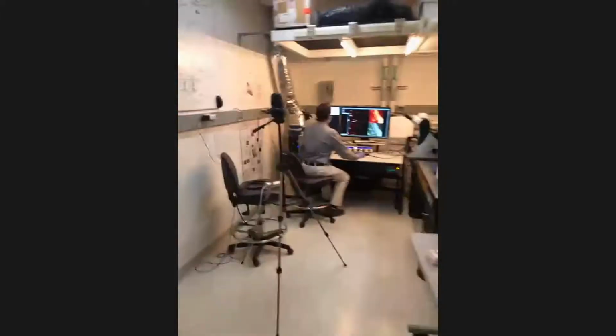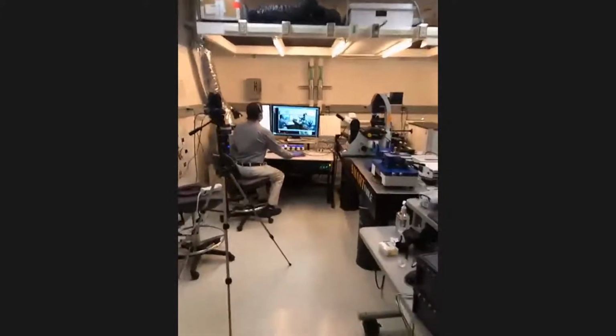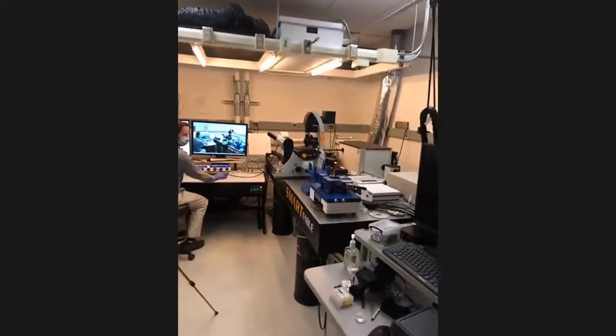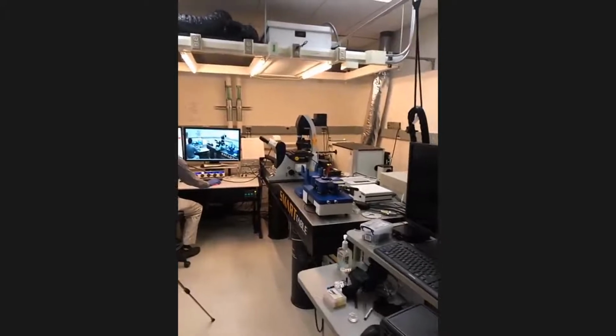Before we jump inside the room with Mike, what you'll see is that we have rooms with collections of advanced equipment. And there's Mike. We'll jump to him in a second. But what I wanted to show you really quickly is that we're going to be highlighting a bunch of fancy equipment like this that we purchase from commercial vendors. I also mentioned that sometimes we're developing technology.